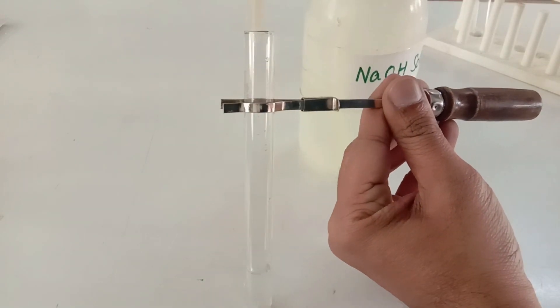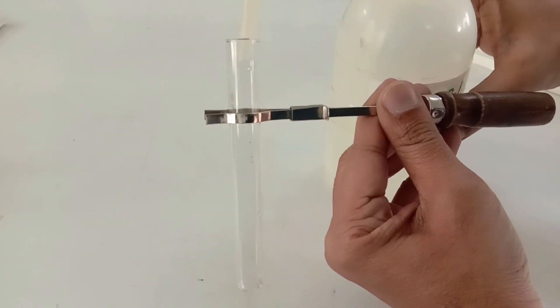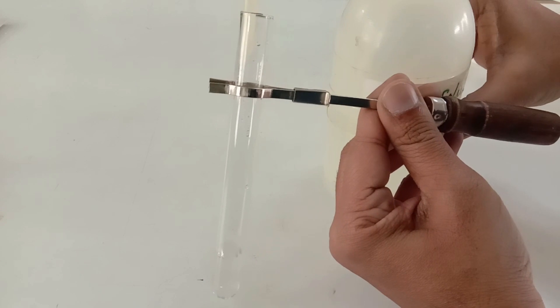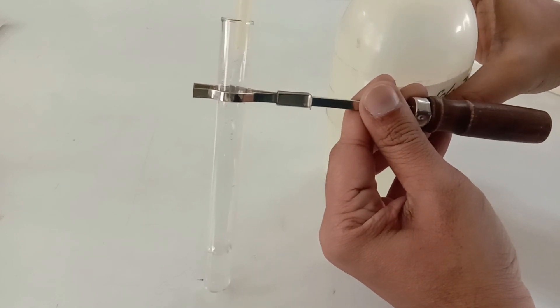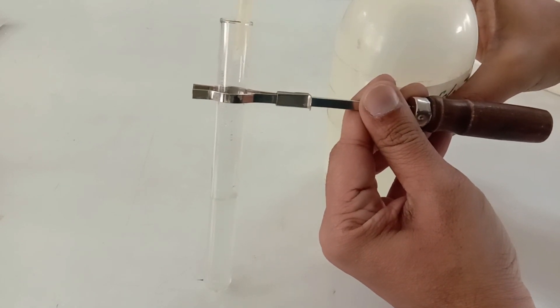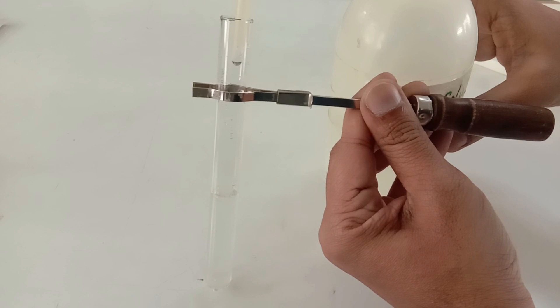Now I'm going to press the plastic bottle and pour approximately 1 ml of sodium hydroxide solution into the food sample.